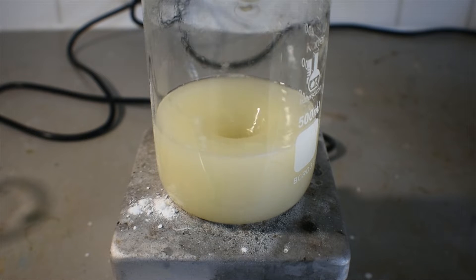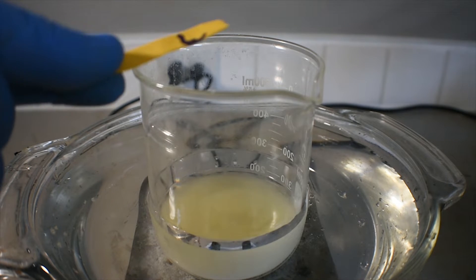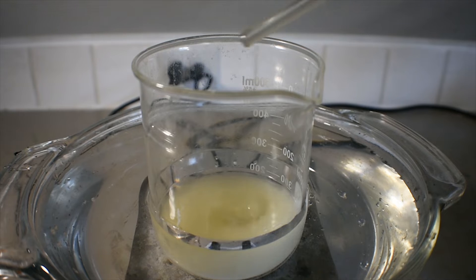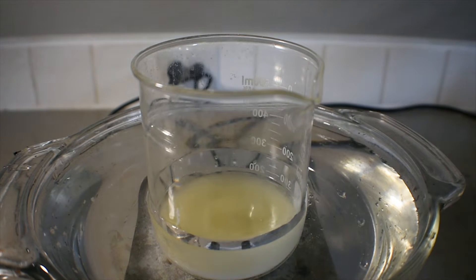Next, this solution is going to be cooled in a water bath. If we test the solution with a small amount of pH paper, we can see that it is extremely basic — we don't want this. We want the solution to be slightly acidic so that all the paraperiodate present is converted to metaperiodate. So for this I'm going to use 40% nitric acid, adding it slowly to prevent any exotherm until the solution is acidic and all metaperiodate has precipitated out from solution.